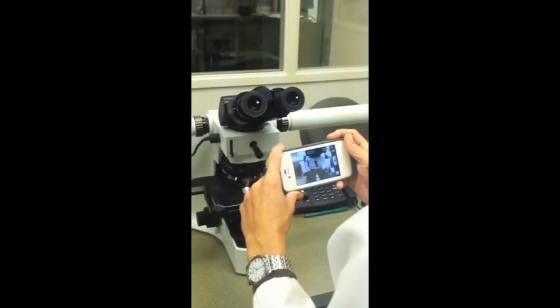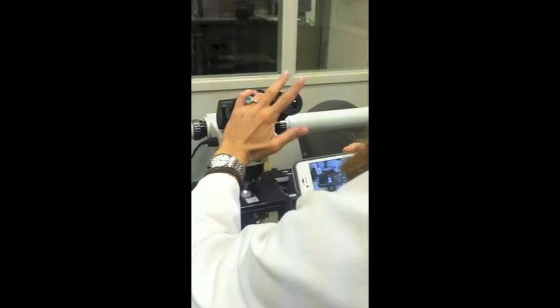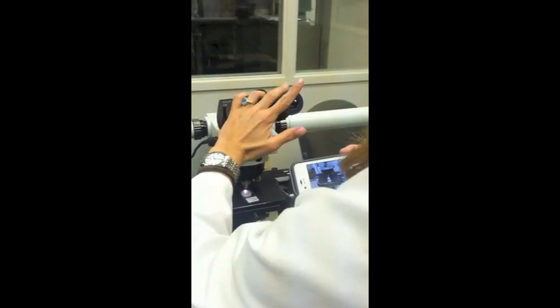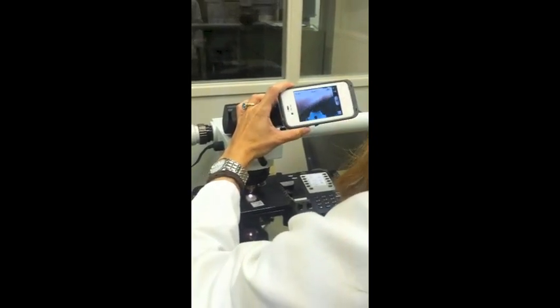The most important thing with smartphone microscopy is stability. So I brace my hand against the eyepiece using my left hand and the last three fingers on the eyepieces. I hold the smartphone between my thumb and first finger.